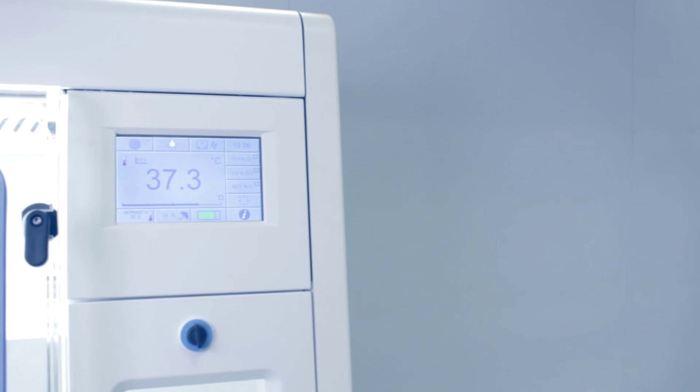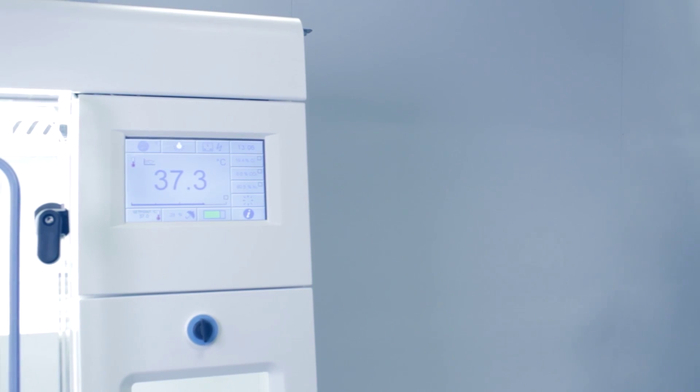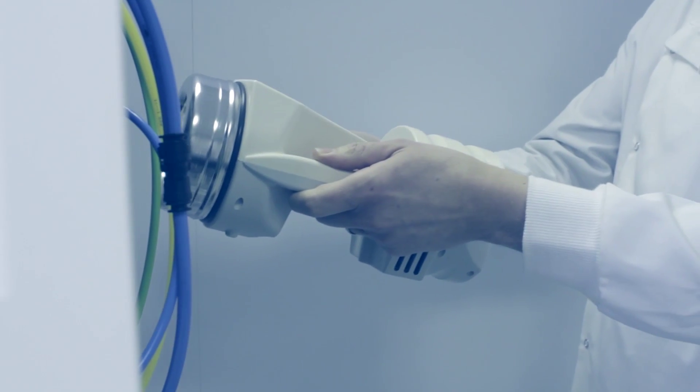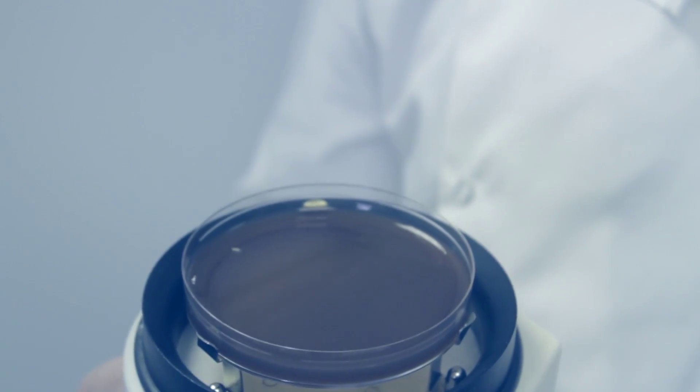We forced the internal atmosphere to be discharged from the chamber, first through the main exhaust valve and then through the interlock exhaust valve. Using an air sampler, we collected 100 liter samples of discharged gas from each of these valves onto agar plates.